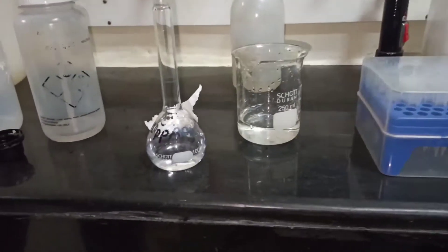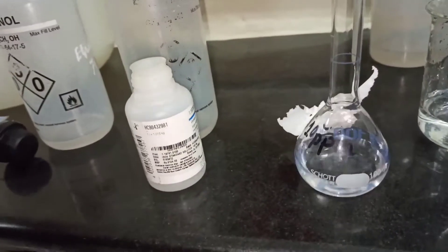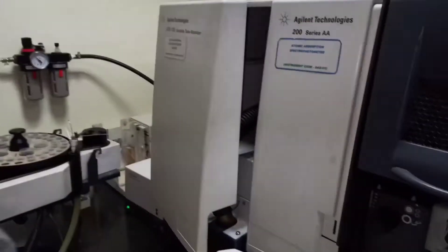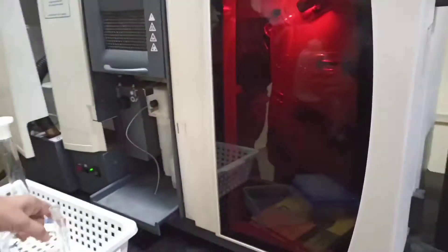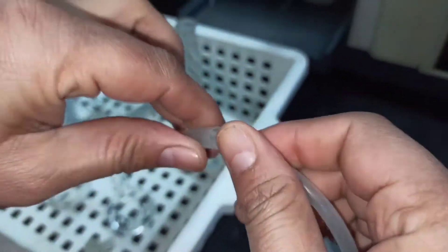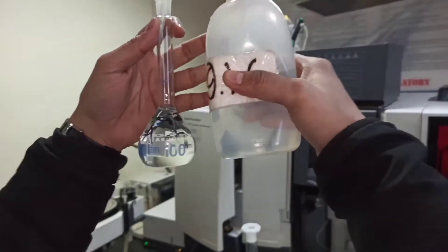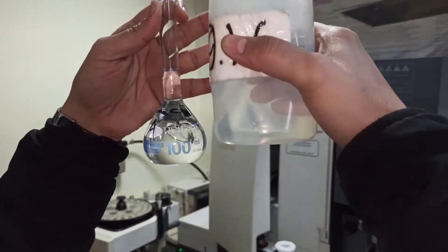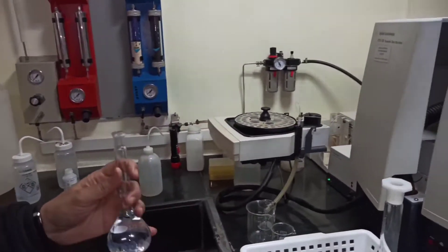Now we will take 1 ml of the iron standard solution from our 1000 ppm standard into a 100 ml volumetric flask. Dissolve thoroughly — mixing is a very important part when you prepare any standards. Mix in a clockwise and anticlockwise direction for at least 30 seconds. Also note: all glassware should be clean, washed with chromic acid and then rinsed with distilled water. Now makeup to the lower meniscus. Our 10 ppm stock solution is ready.